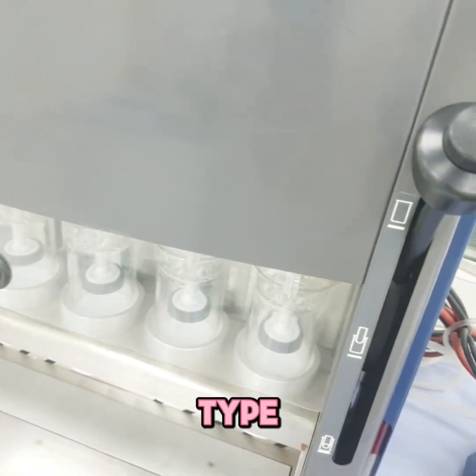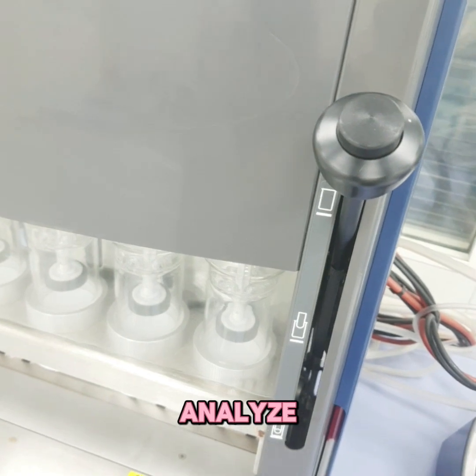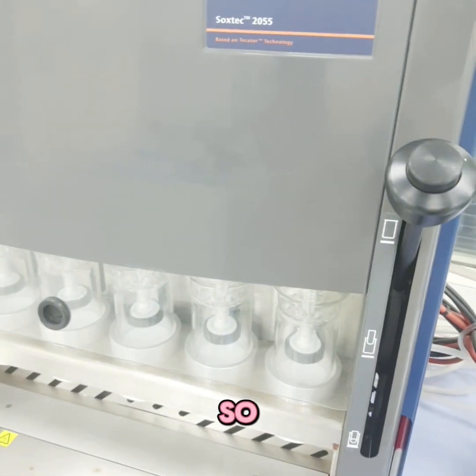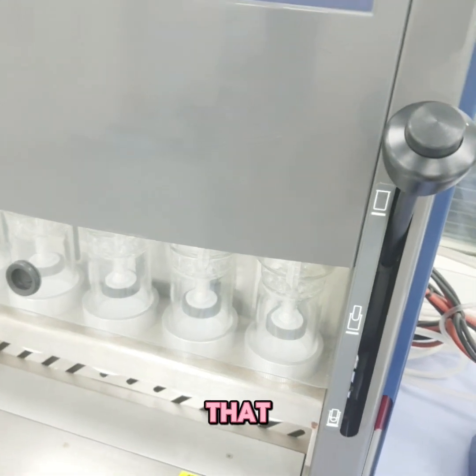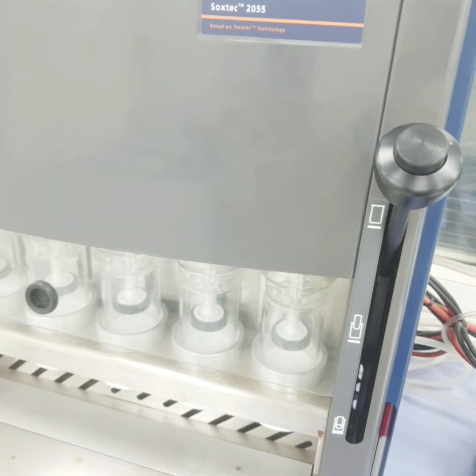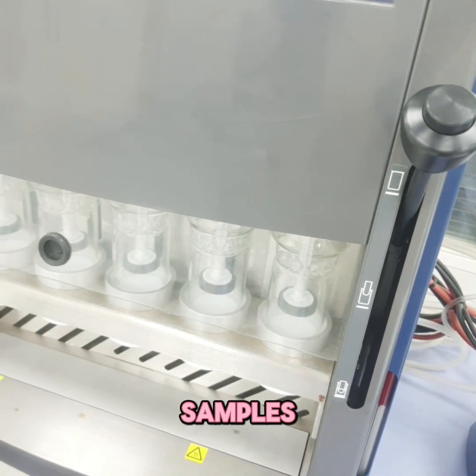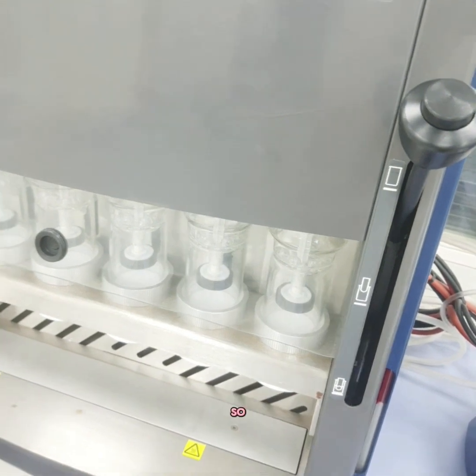Solvent volume ranges from 40 to 90 ml depending on the type of sample being analyzed. Extraction time goes up to a maximum of two hours. You can analyze six samples at one time and up to 30 samples per day, making this system significantly more efficient than conventional methods.